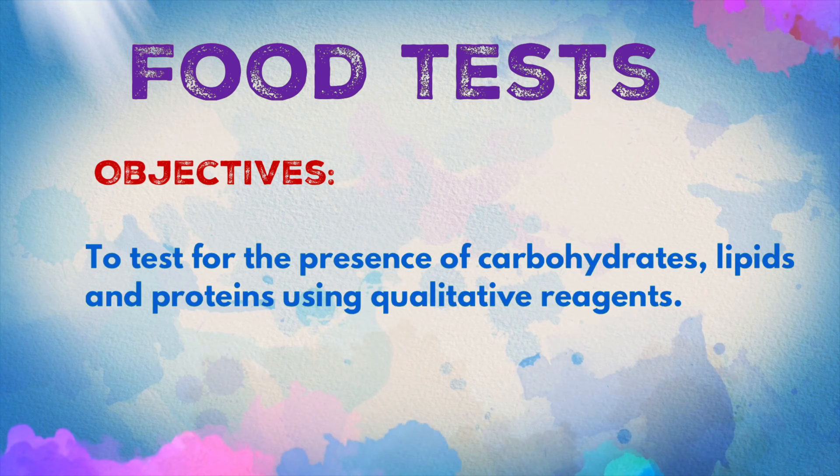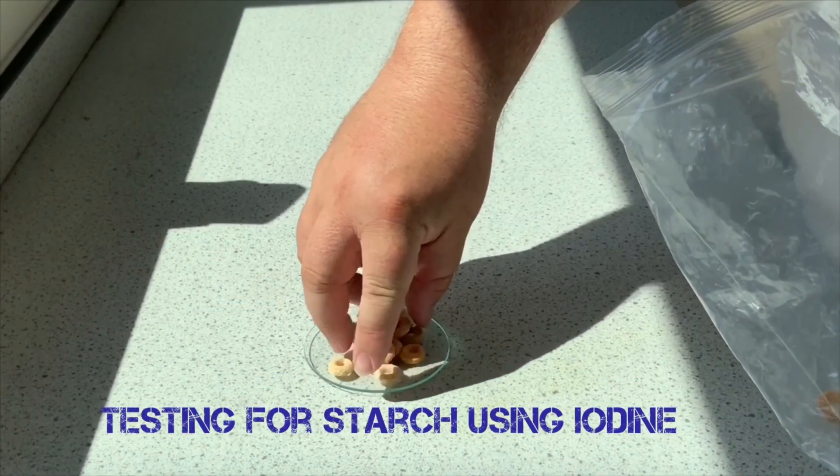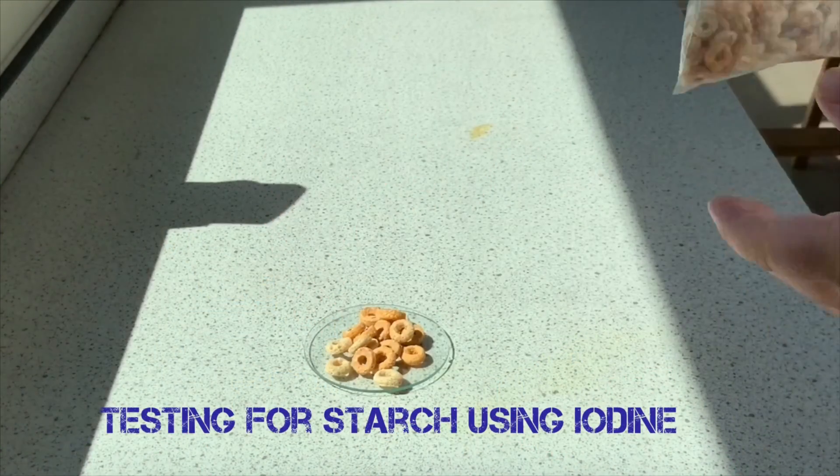To be clear, qualitative means testing for the presence rather than the quantity or number.